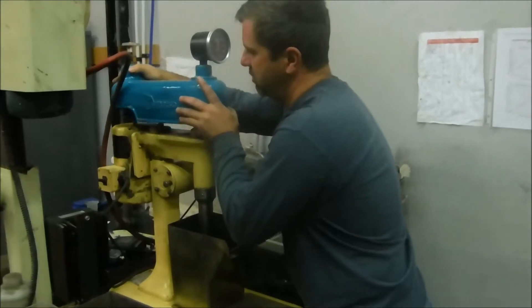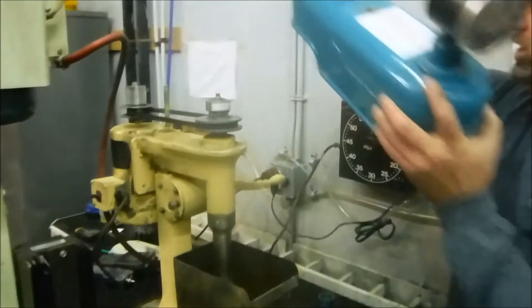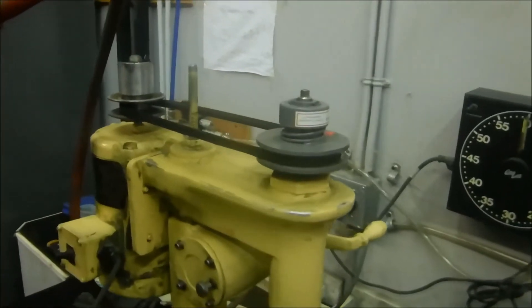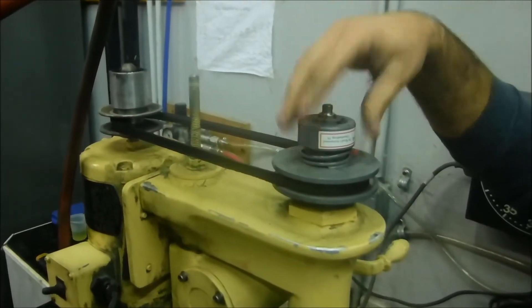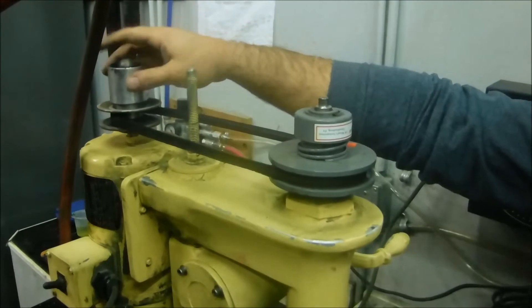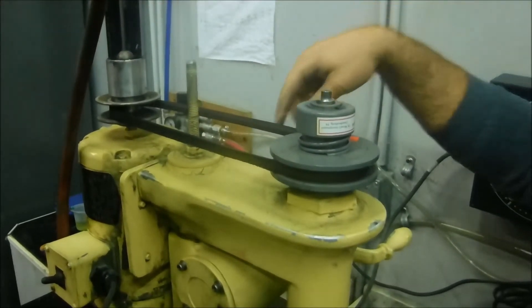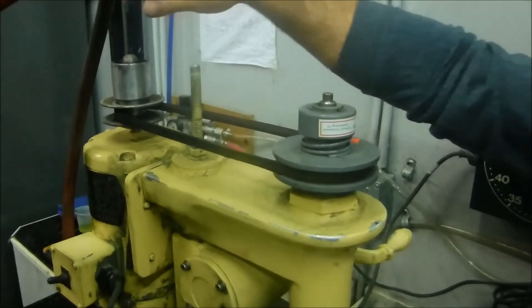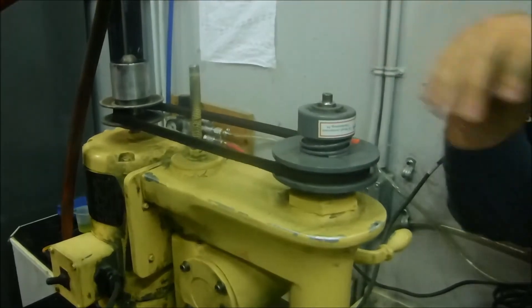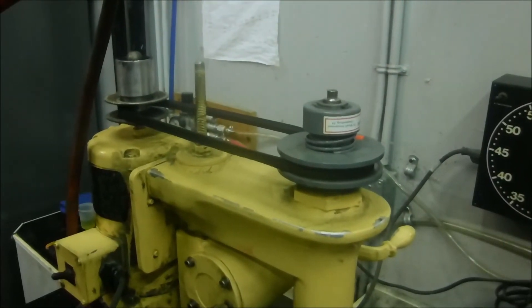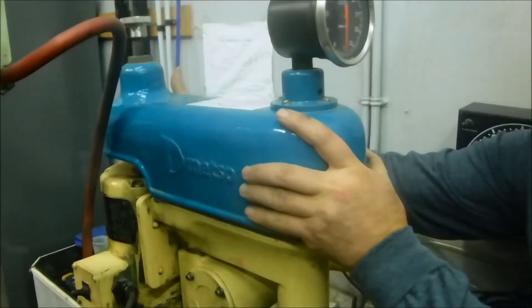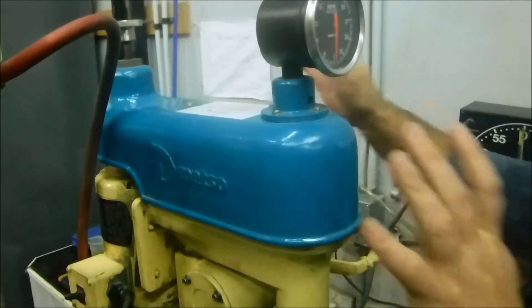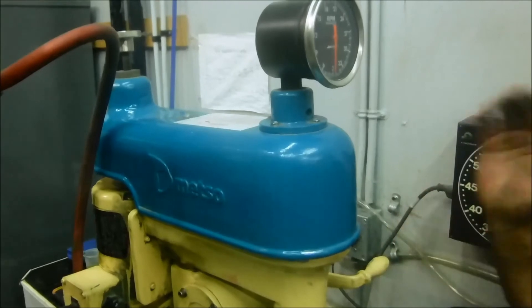We'll show you under the hood. The Metso machine is a mechanical clutch. The mechanical clutch is back here, driven off the motor. You apply pressure with the knob on the back to change the speed. It's all belt driven. There's no electronic driver on this, it's all mechanical.